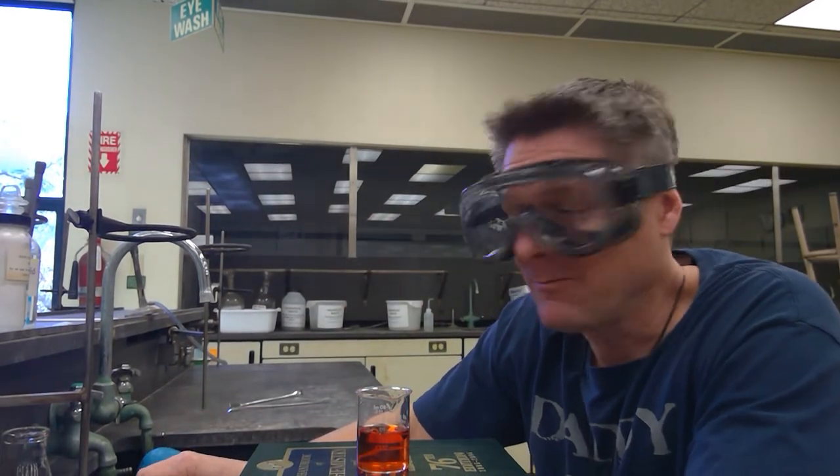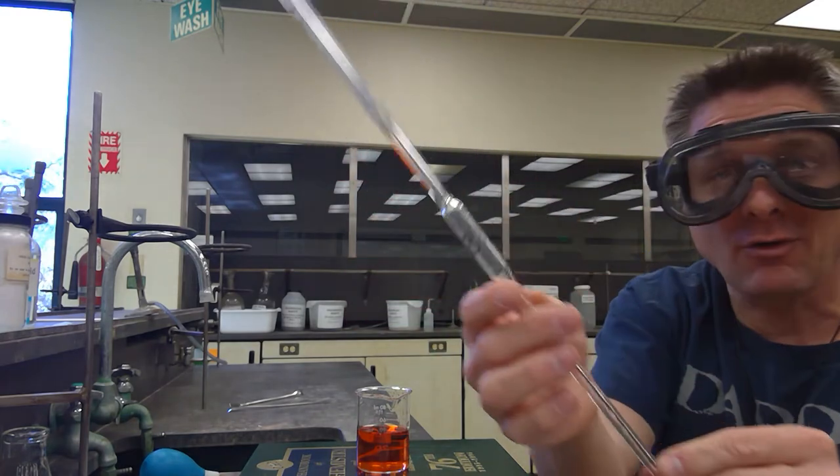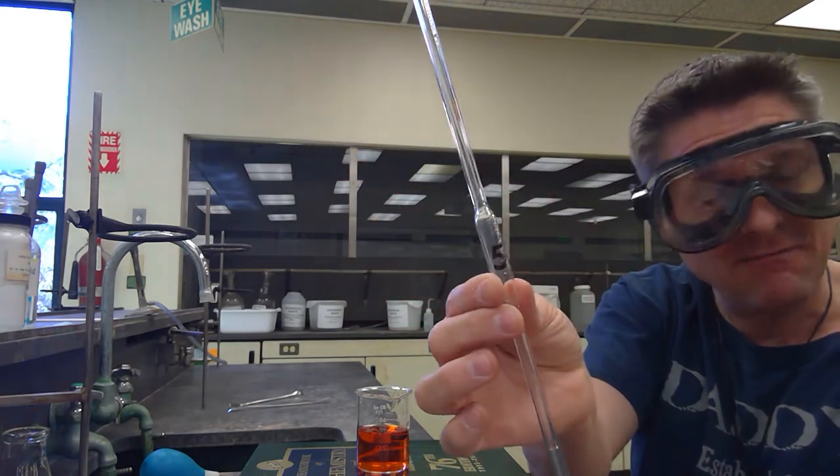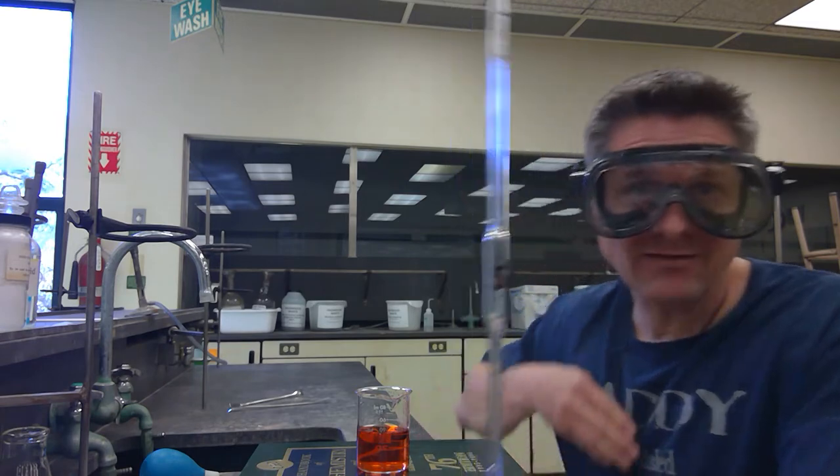From the locker supplies video, we had transfer or volumetric pipettes. This happens to be a five milliliter one. You also have a 10 milliliter one. Those are good at two decimal places — so 5.00 milliliters, that would be one aliquot.